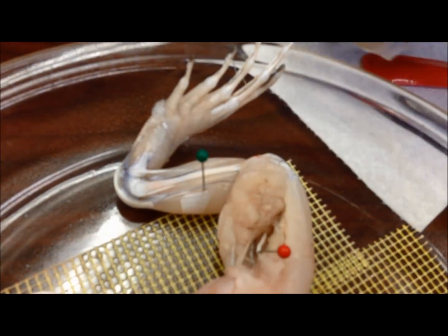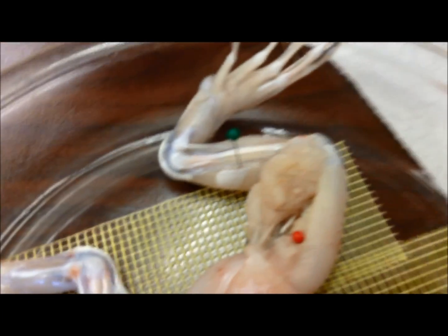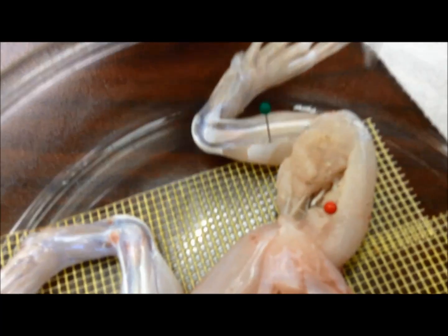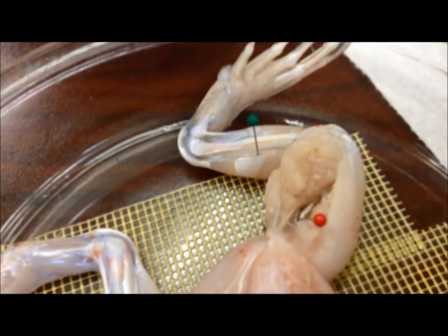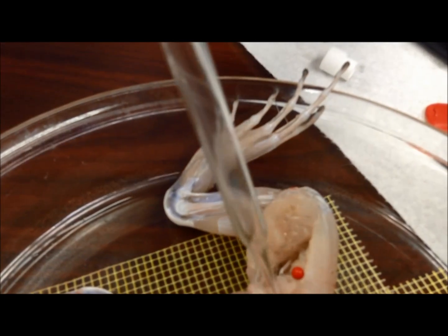Do you have the electrode? Yeah, let's try it. He's gonna do it! Is that the electric stuff? It's just a battery — a heavy power battery? No, just a regular one. Yeah, it's not enough to feel any current.